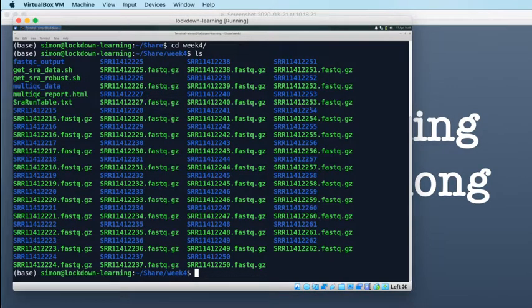Right, okay, so I've made a copy of my script and I've called it get SRA robust, which is perhaps not the best name in the world, but it'll do for now. And if you remember what I had talked about, my plan was that I would use the file sizes in the SRA run table that we downloaded and check the data that we downloaded against the file sizes in that run table.